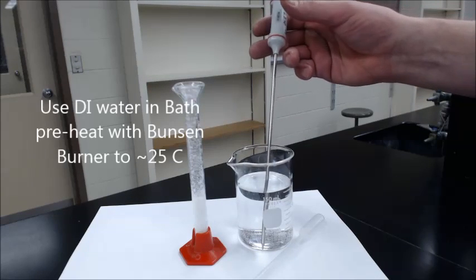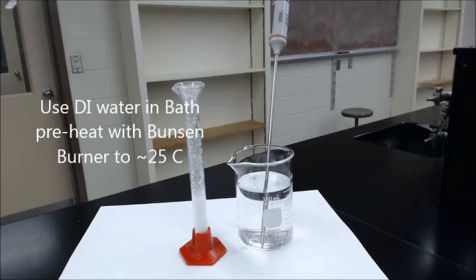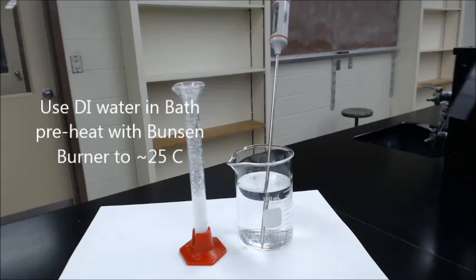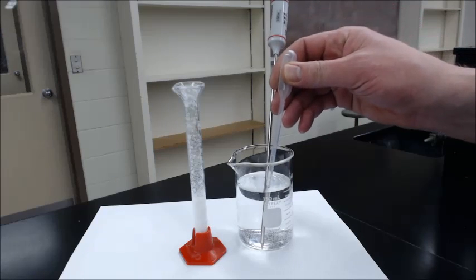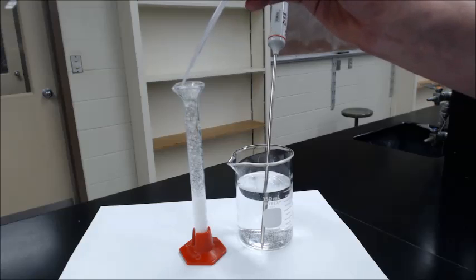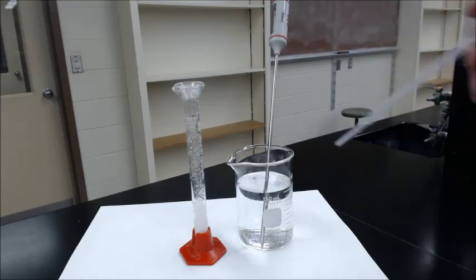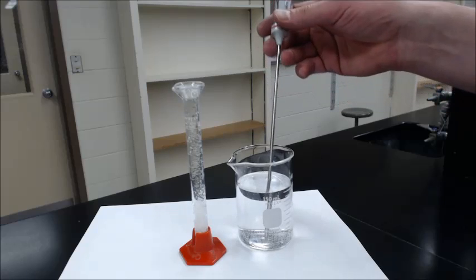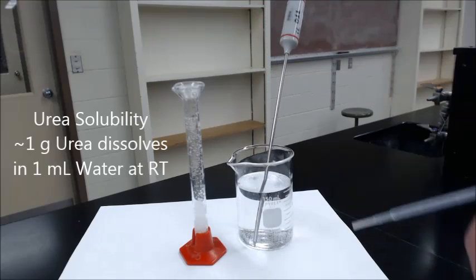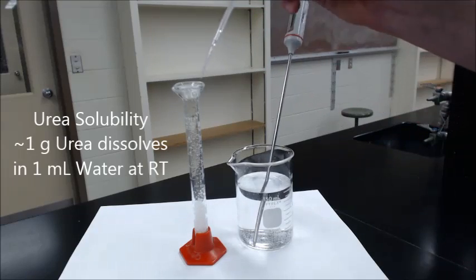Now, the reaction to dissolve urea is endothermic, so we're going to see the temperature change. So we just take a little bit of urea and get it in there. It doesn't take much water. The students are informed that it's about one gram per ml. We'll put just a little bit more.